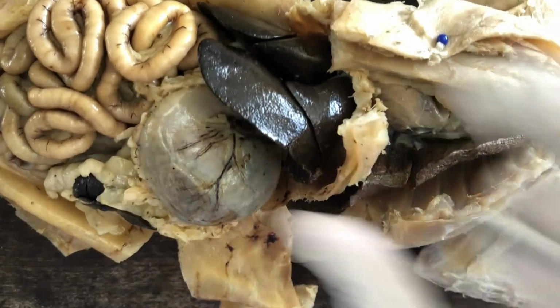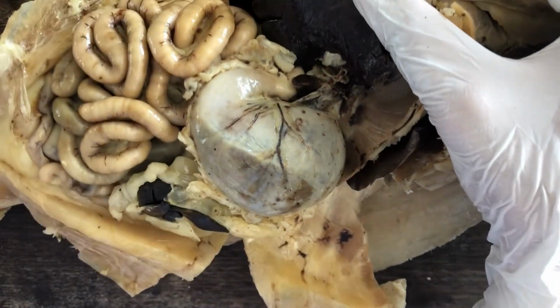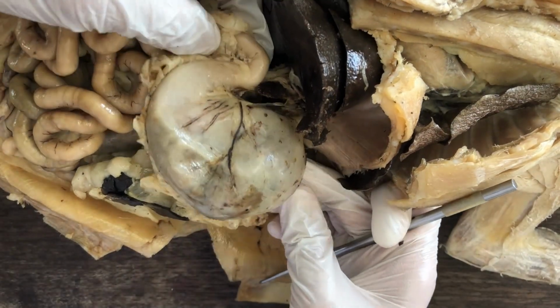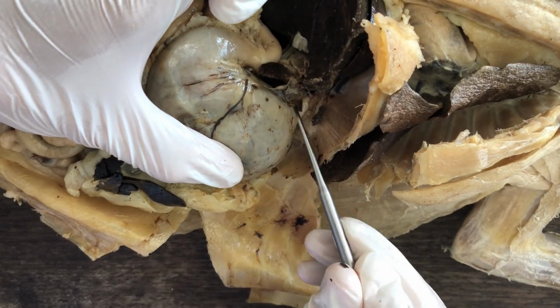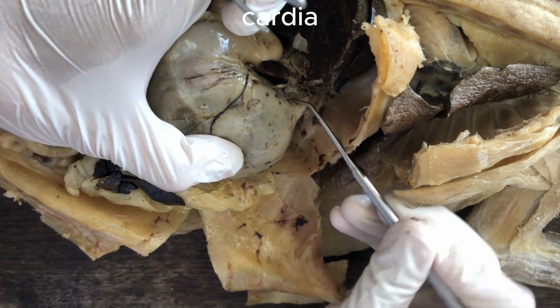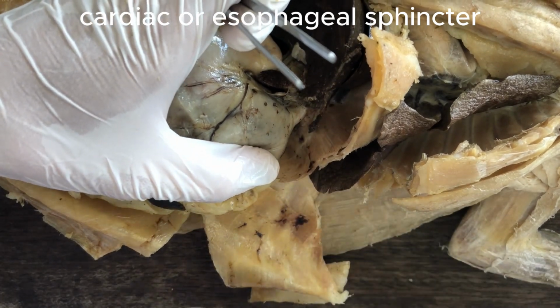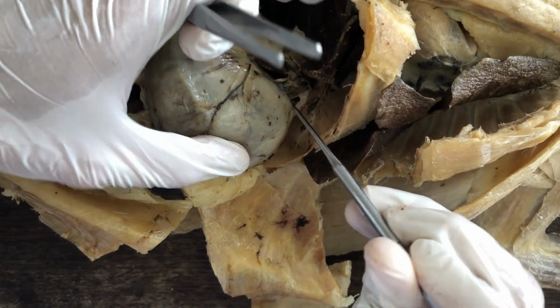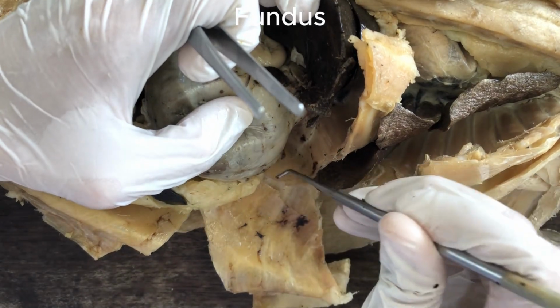Obviously, it had a huge meal before it died, sadly. So it's distended. The portions of the stomach are not very visible or obvious. But there are parts, different parts of the stomach. Right? The one nearest the point of entry of the esophagus is called the cardia, or the cardiac end of the stomach. So that region contains a sphincter called the cardiac sphincter or cardiac valve, which regulates the entry of food from the esophagus to the stomach. And then just adjacent or beside the cardiac end of the stomach is the fundus. Okay, the fundus next to the cardiac end.